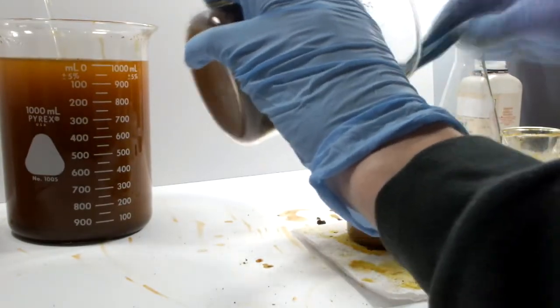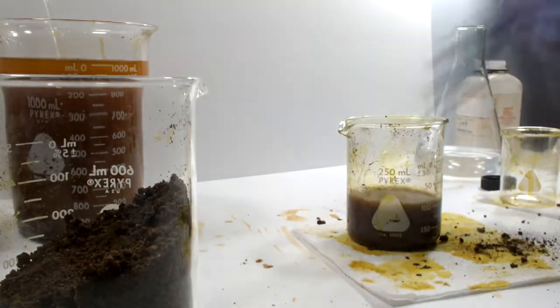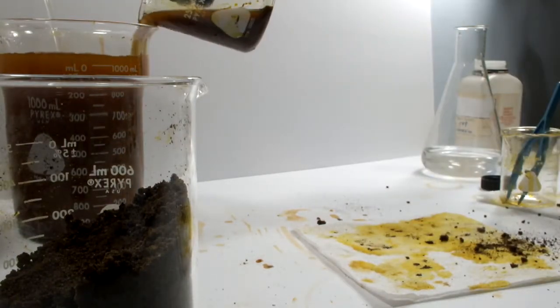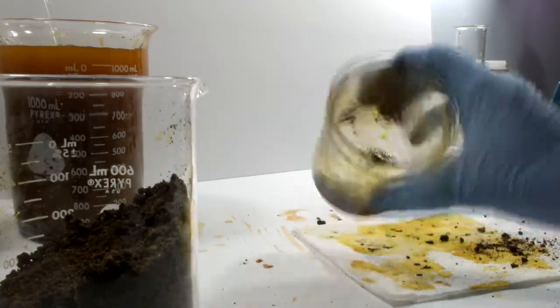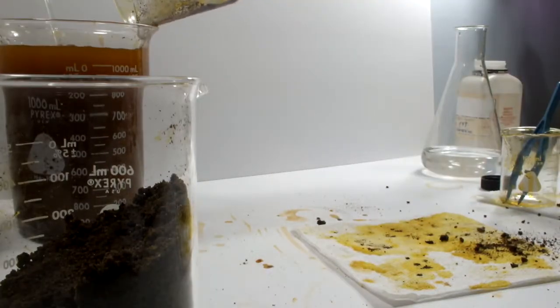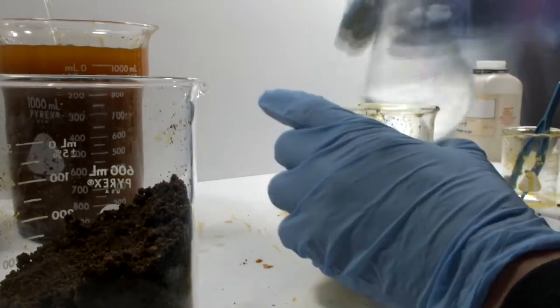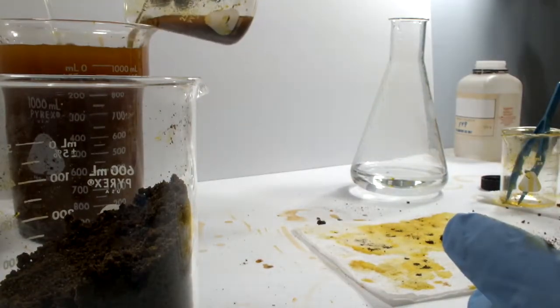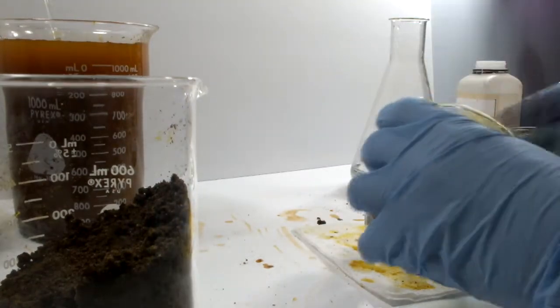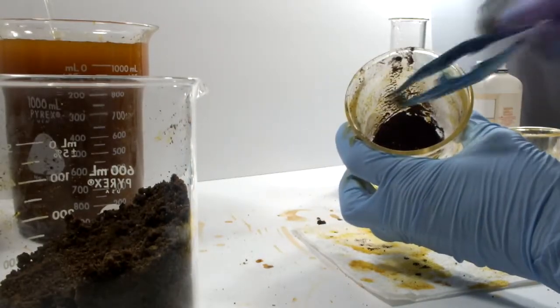I ended up developing a process that can handle more than one chunk at a time. Dump an amount of the garbage into some reasonably clean water, stir it up so the big pieces have a chance to break up, then decant the water. Inspect the residue and fish out the crystals of iron 2 chloride as they show up. It's sort of like panning for gold. They're pretty easy to spot, but I watched as dozens of them dissolved right before my eyes as I was trying to fish them out. It was very frustrating.